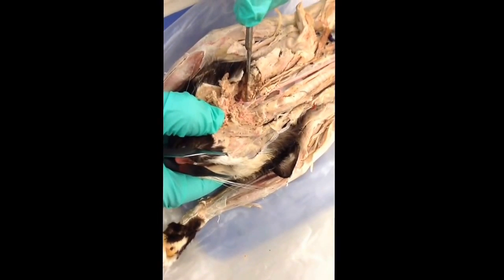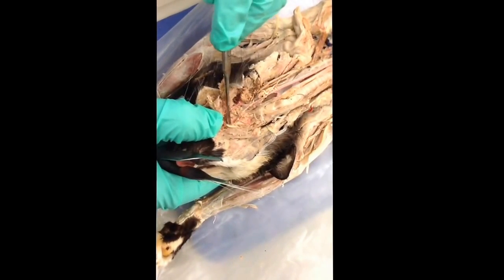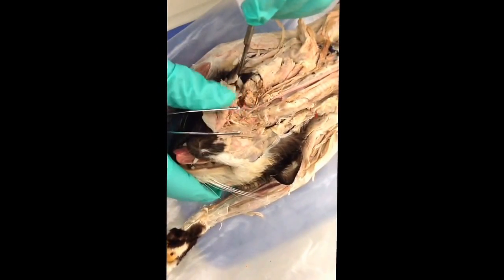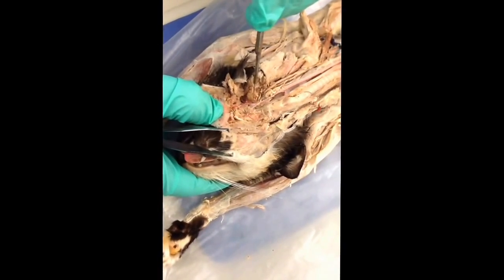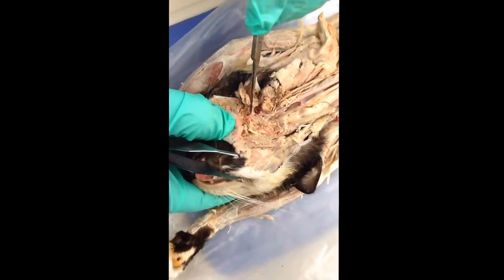The curve is the external carotid. The one going straight up this way, and again, sometimes we'll see a better injected one, coming up this way is the lingual. Okay? Now, the main thing that we emphasize as a branch off of the external carotid, the curve in the road, is the external maxillary, a small artery which does have several branches.